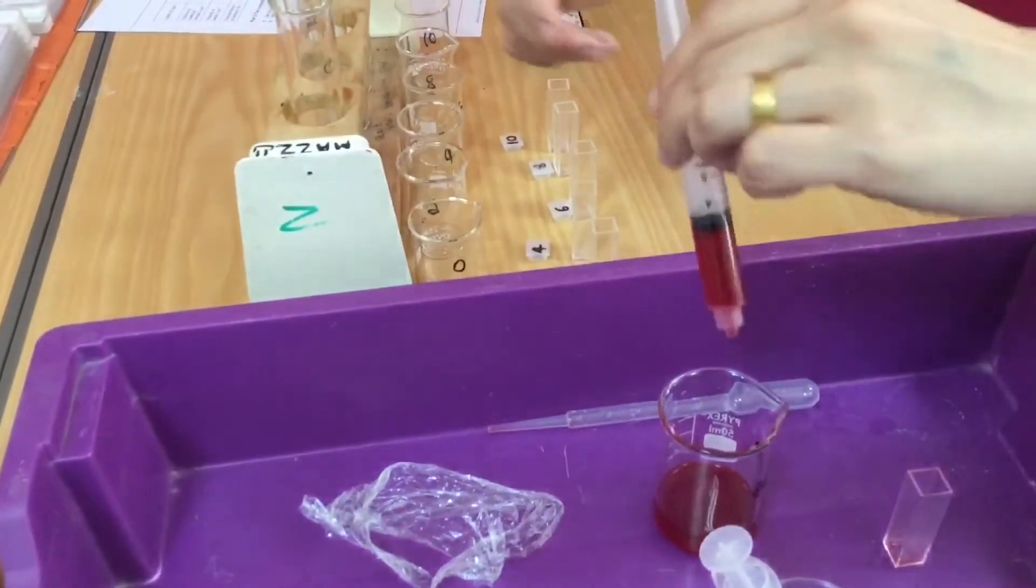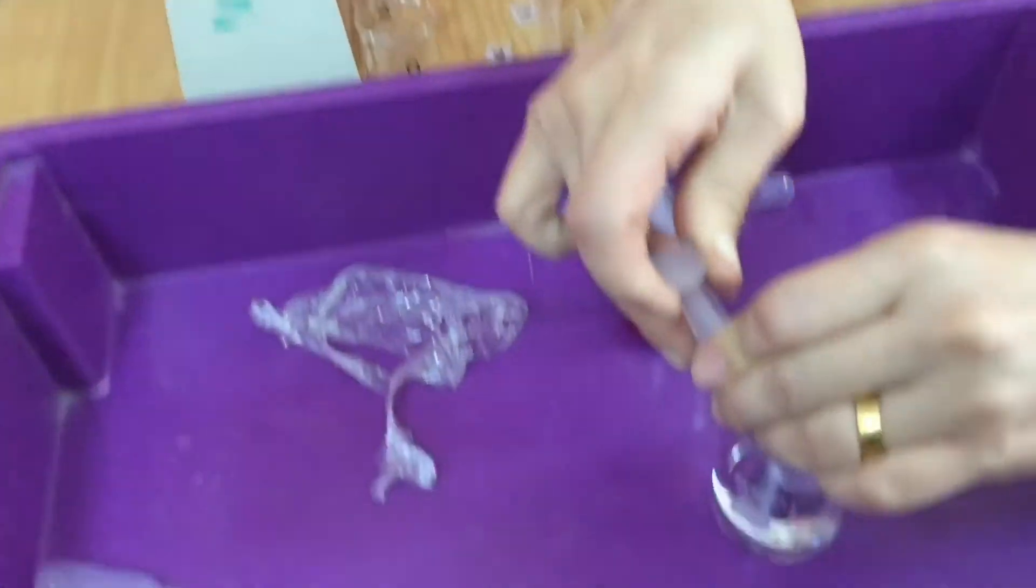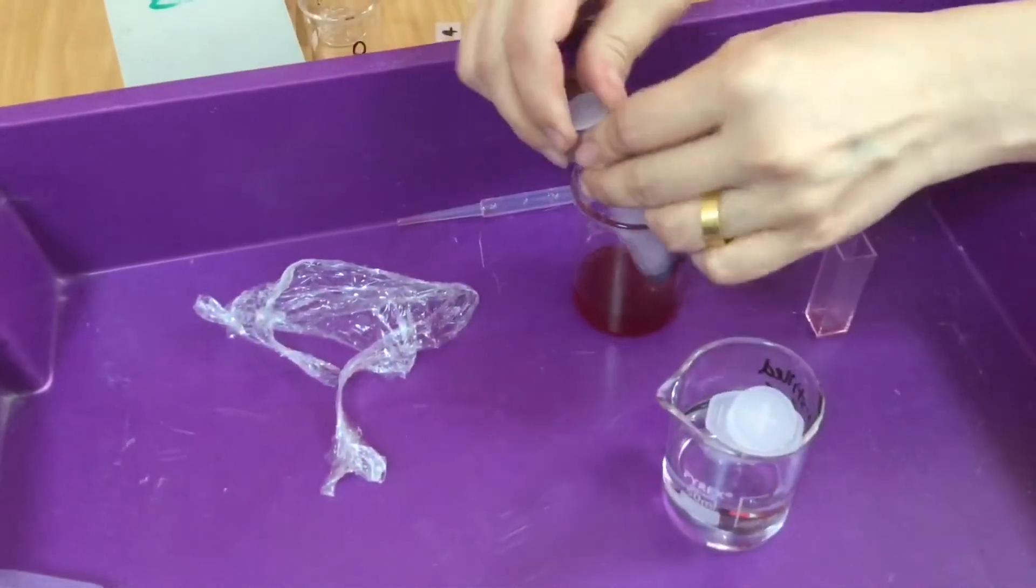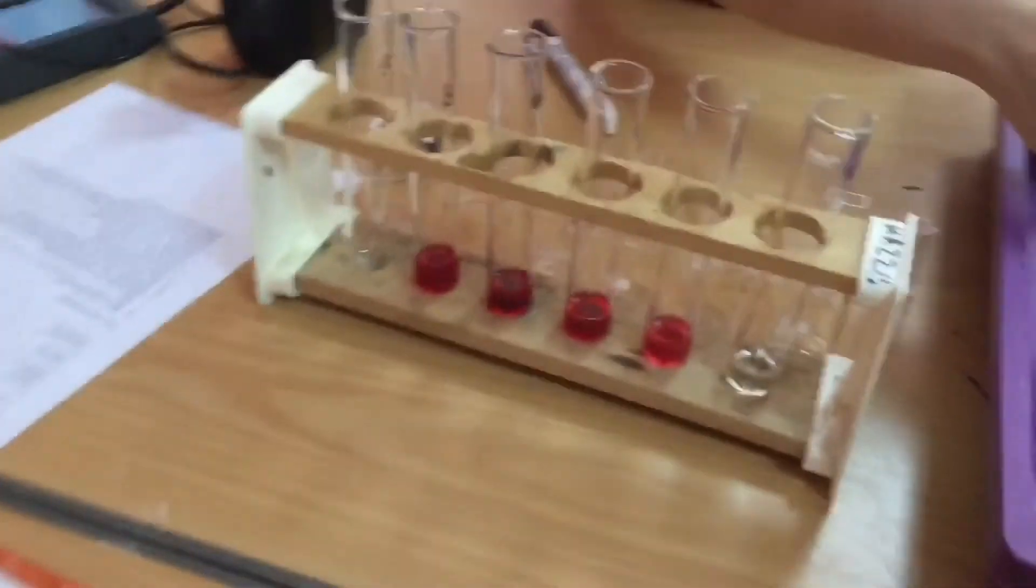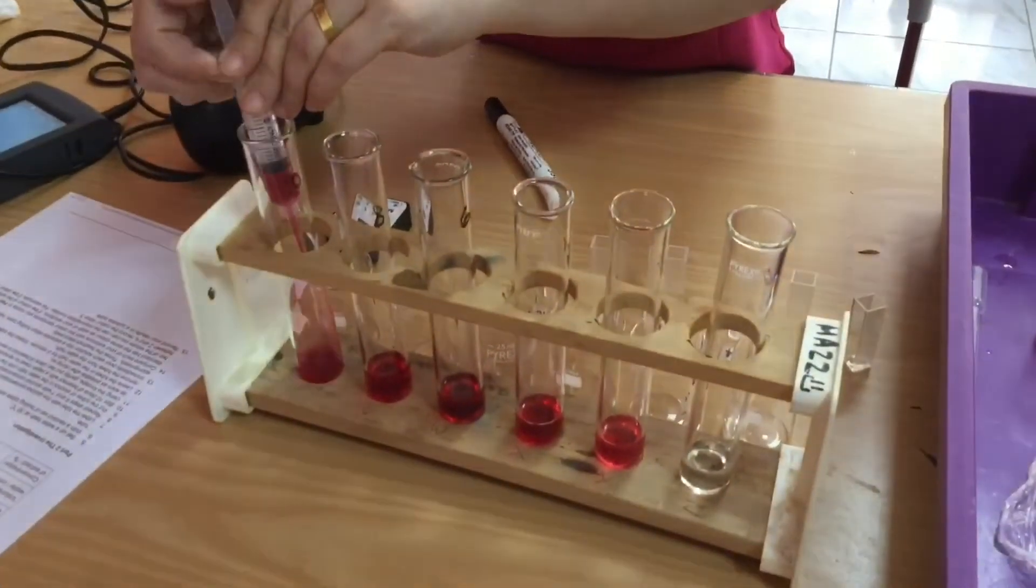Next one, I'm going to put 3ml of my stock solution, 2ml of the water. And then in the next one I'm going to put 4ml and 1ml. And in the last one I'm just going to put 5ml of my stock solution.